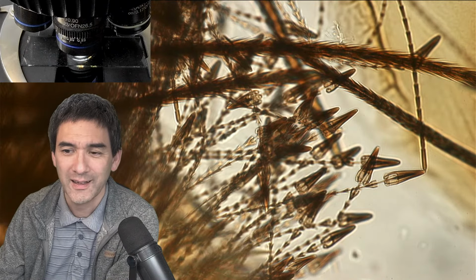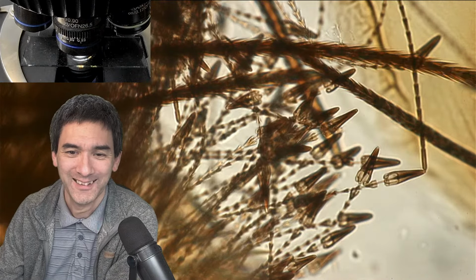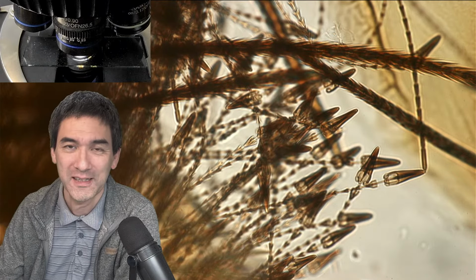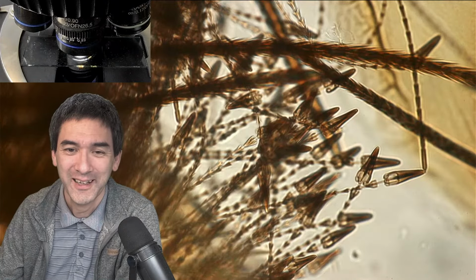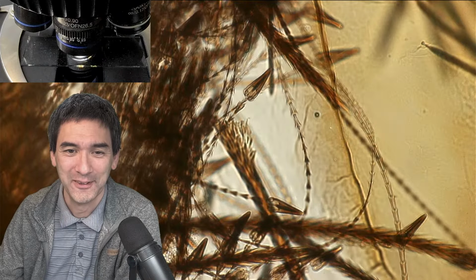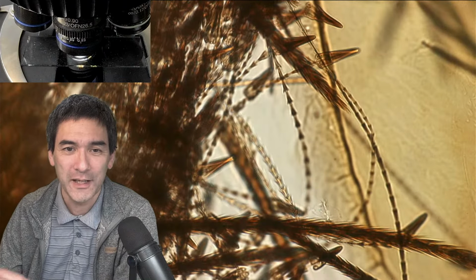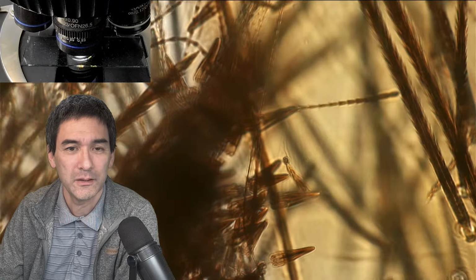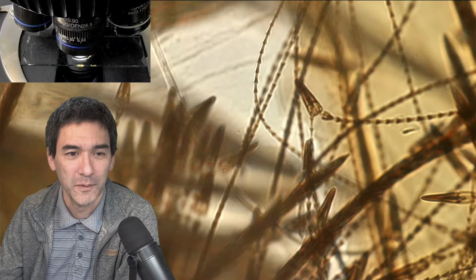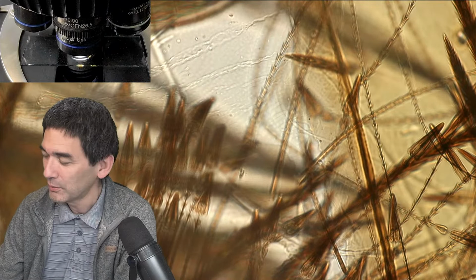I better not forget to label it. You're gonna laugh, I actually had it lying around here with a couple of other slides, and I had to check a few slides until I found it. So very nice sample. I'm generally quite happy with the result here. Okay, so we're gonna move on.